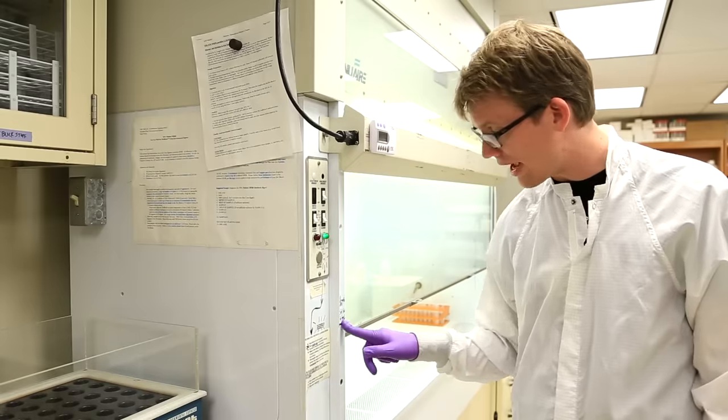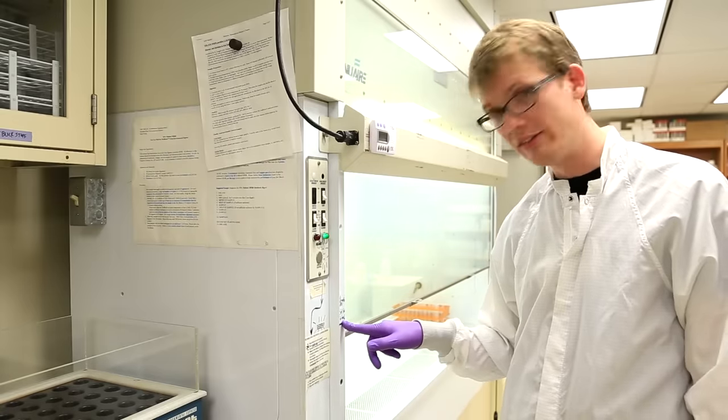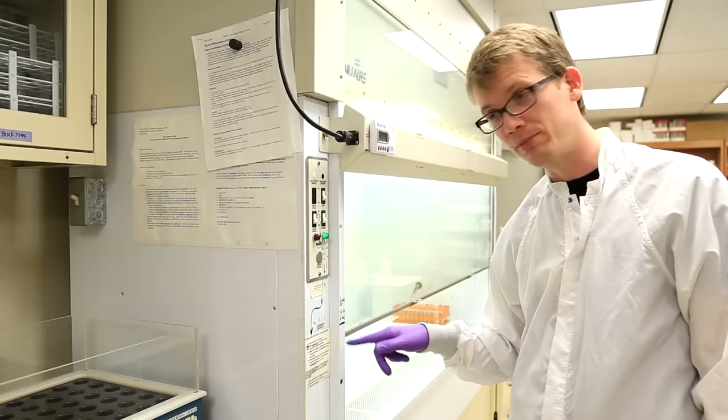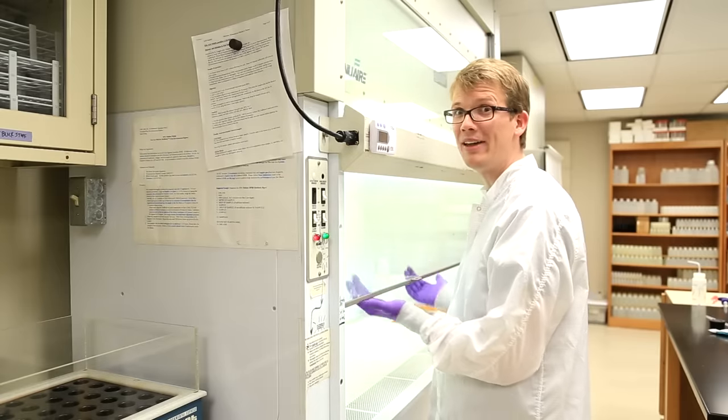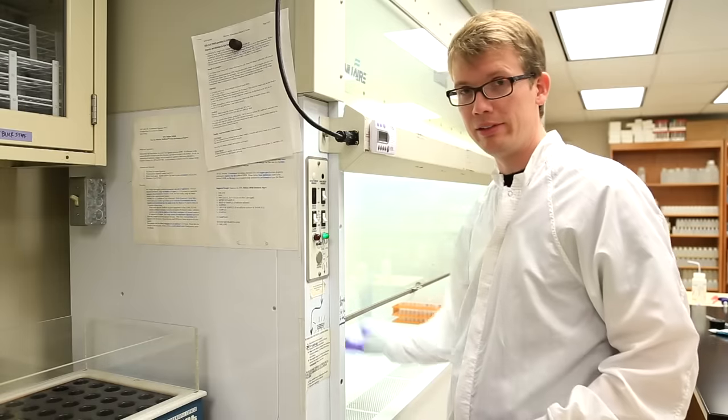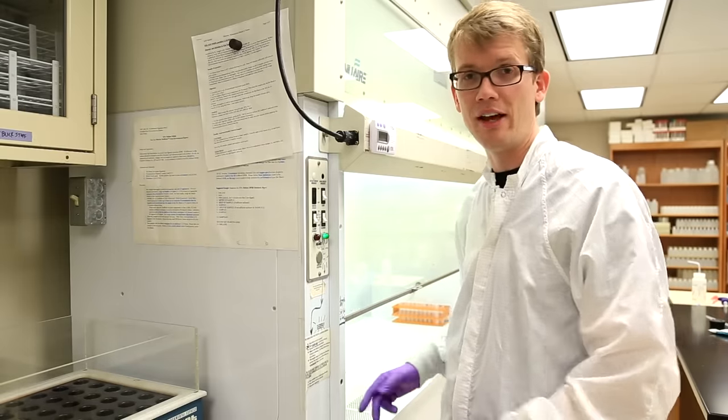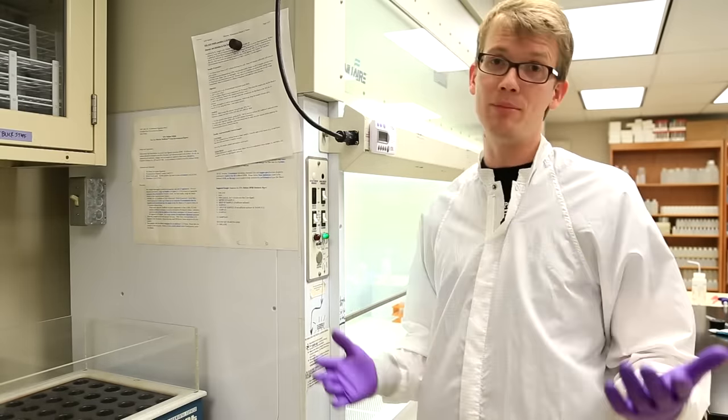Second thing you want to do is make sure the sash is at the right level. This has a little thing that tells you where the sash is supposed to go. If you go above that, on this model, it'll buzz at you. If the sash is higher than that, it's not going to properly vent all the stuff to the outside, and some of it might get into your face, and that would be bad.